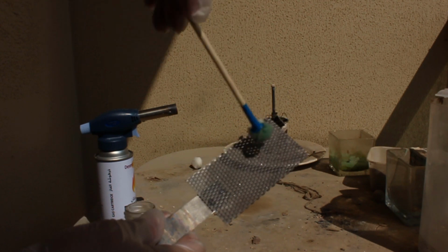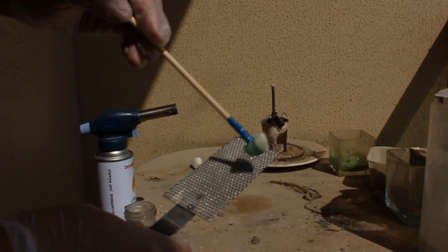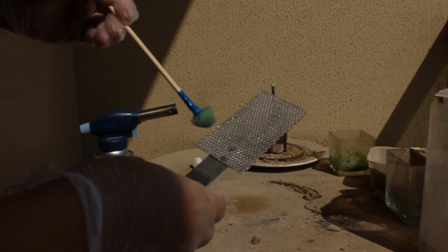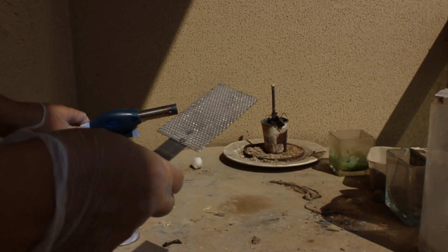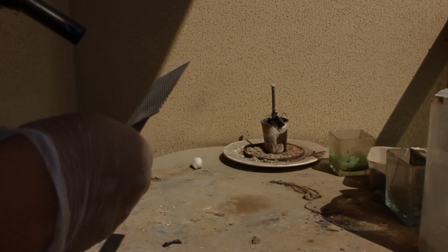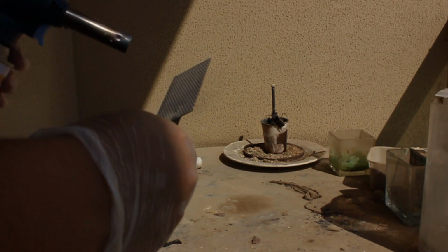I like using a sponge because this won't react with the painting solution. Using anything else has a chance of reacting with it. I learned that the hard way in previous attempts. Anyway, after you've painted, you have to set this aside, far from your flame source, because then you're going to have to bake it. But you're going to have to bake it till it makes a silvery gray color, like a matte gray color.